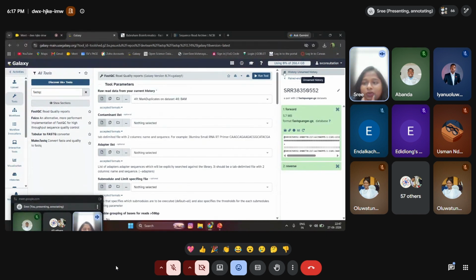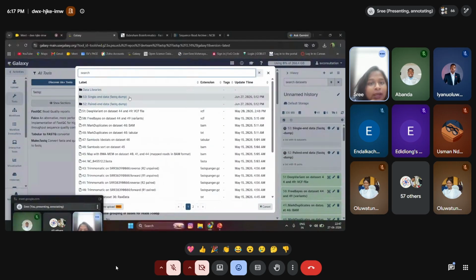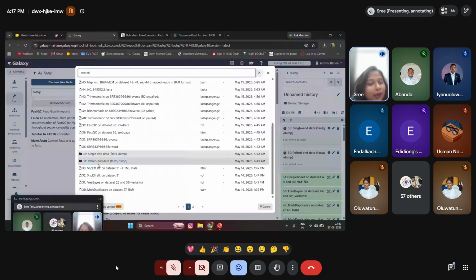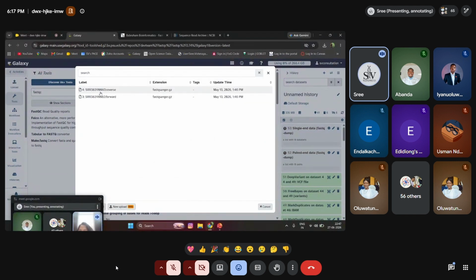So we'll go back to the history. It's still loading over here, maybe because of the internet. So I'm going into search. If you want to get information, I'm just giving a search. That will be empty for you, but I have uploaded the larger file over here. I'm going and selecting a specific dataset.